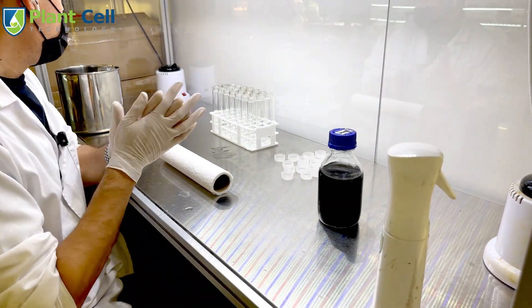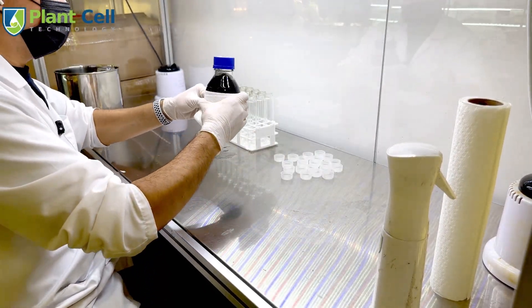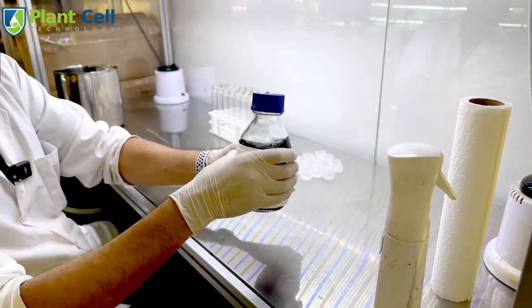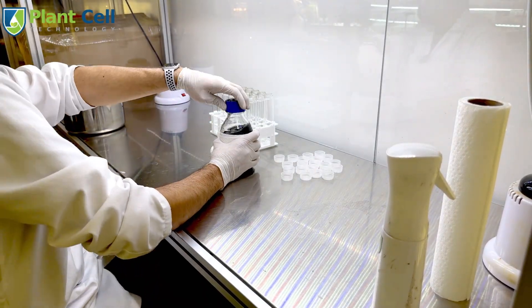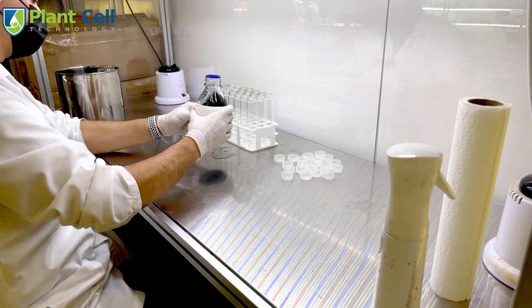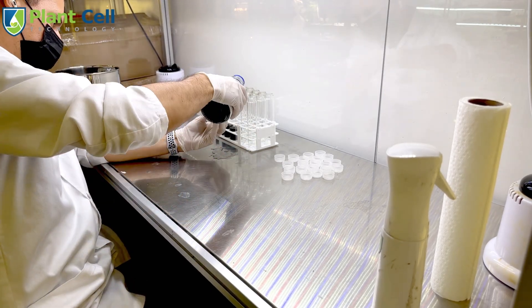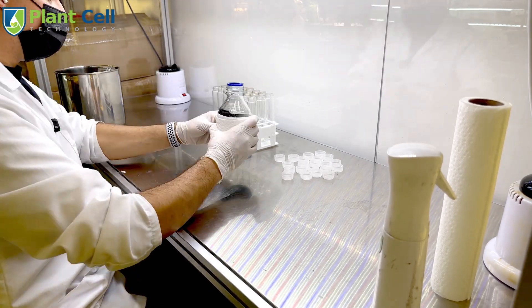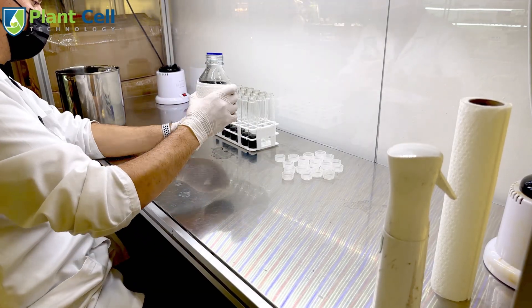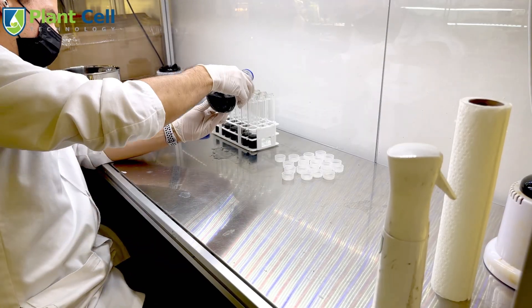This video is about how to use the sterilizers, but it's also important to show you how to pour the media, because this is one of the biggest mistakes I see beginners make — not shaking the media bottle after each pour. If you are using activated charcoal in the media, the charcoal is not going to dissolve like agar, so it will settle on the bottom and you'll end up with some tubes or flasks with more charcoal than others.